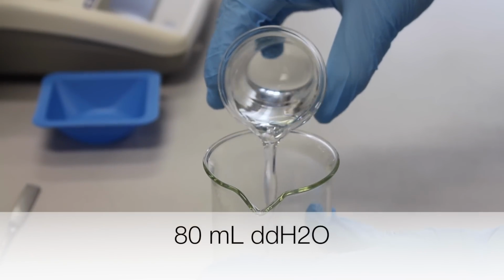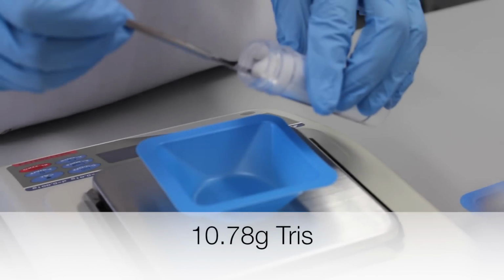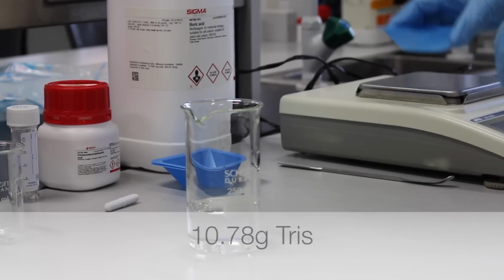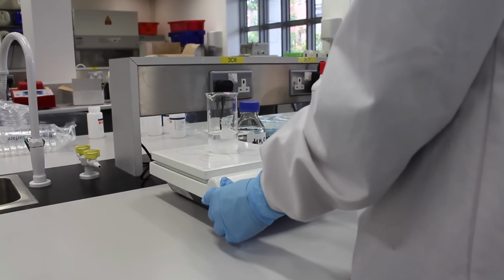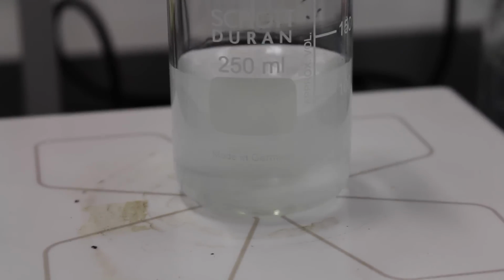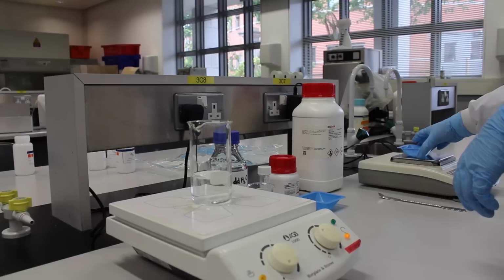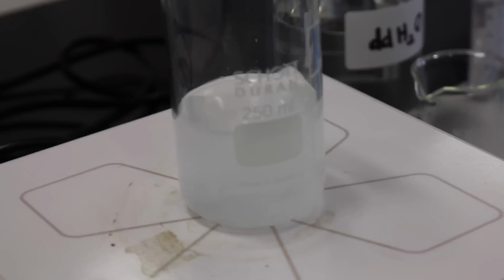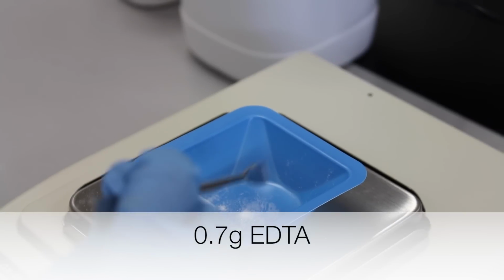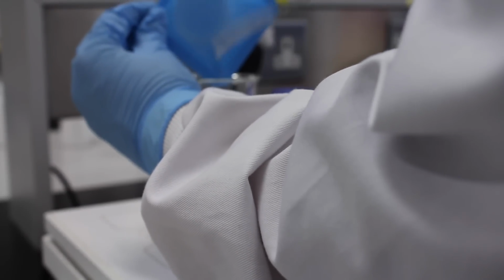80 milliliters of water is added to a beaker. 10.78 grams of tris is weighed out and added to the beaker that contains the water. Tris is dissolved in water using a magnetic stirrer. 5.5 grams of boric acid is weighed out and added to the same beaker that contained tris. Boric acid is allowed to dissolve. 0.7 grams of EDTA is weighed out and added to the same beaker.